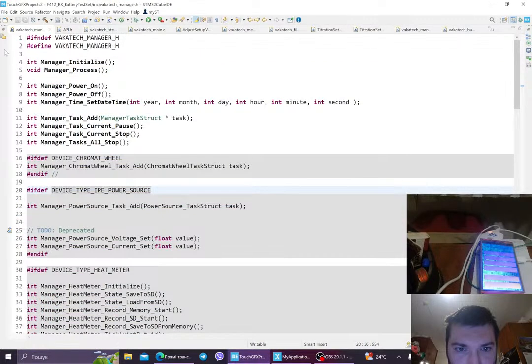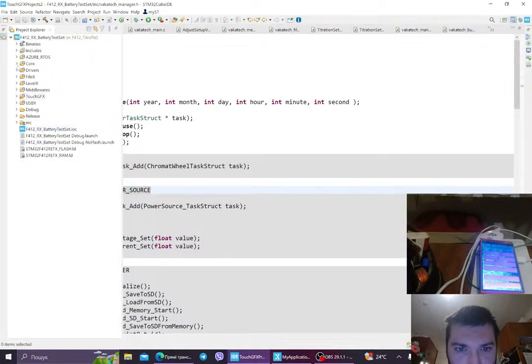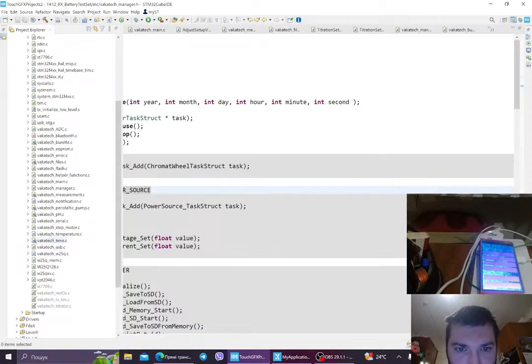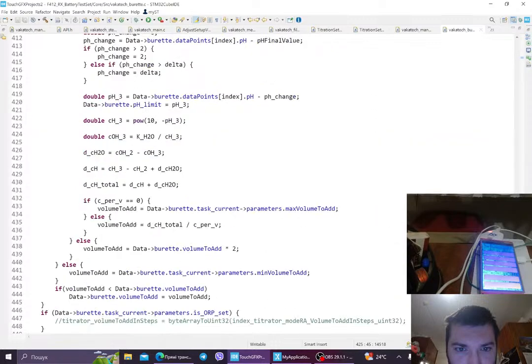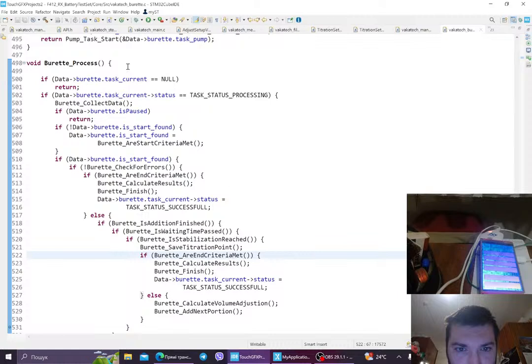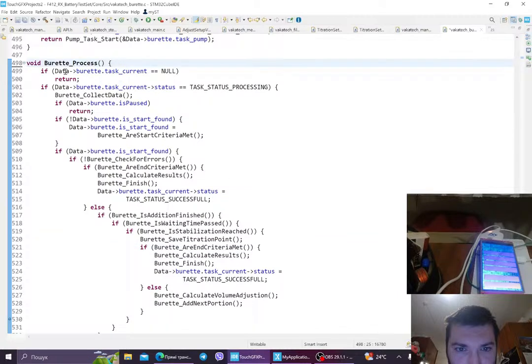Yeah. So here we have our project, and this is all the files that I'm using. And for the burette, it's actually like the vakatech burette. Yeah, so here we see the main loop for the burette, and I have the underlying structures as, again, tasks.